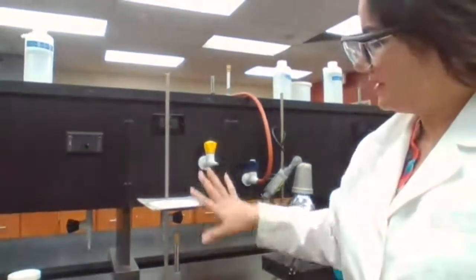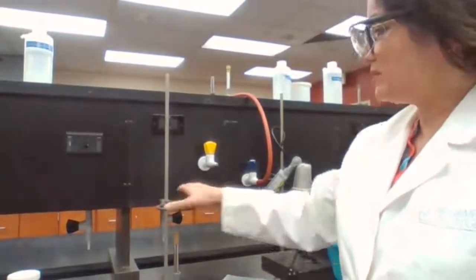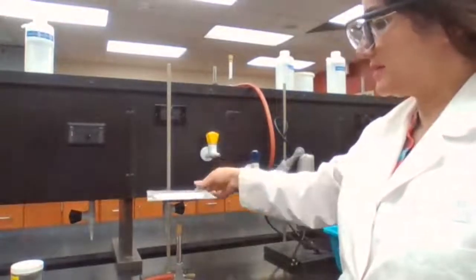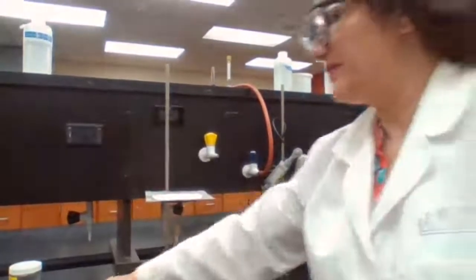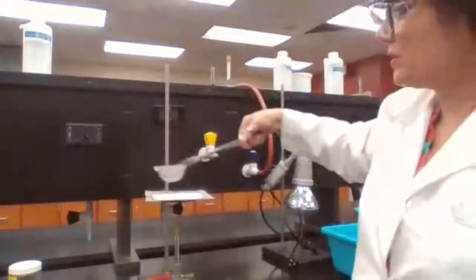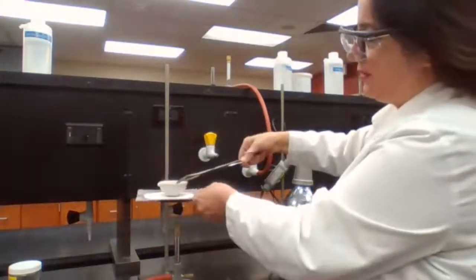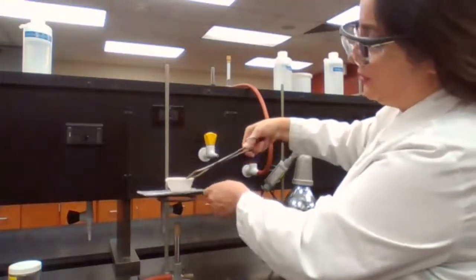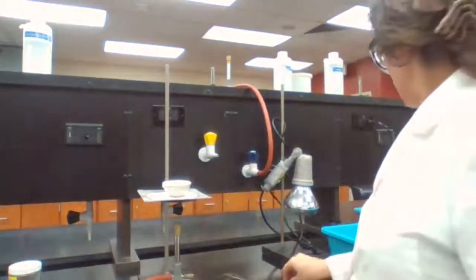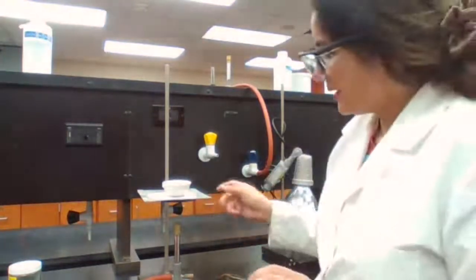So I have my Bunsen burner set up. To set up the Bunsen burner, I use an iron ring here to support the wire gauze, because later on I'm going to place my evaporating dish on the wire gauze. So there's something to support it, because I cannot depend on this. It's safer if I'm using a wire gauze, or sometimes we could use a clay triangle, another equipment that we could use, but wire gauze is more secure.